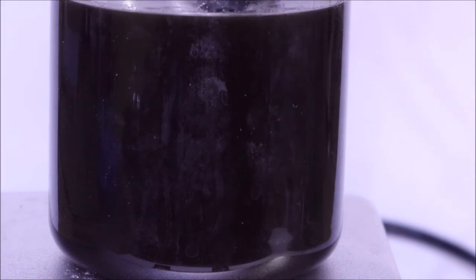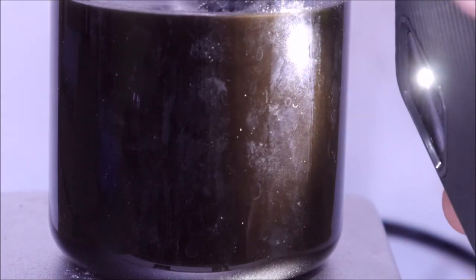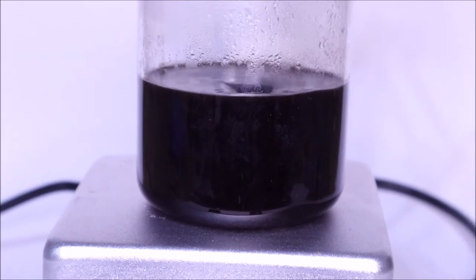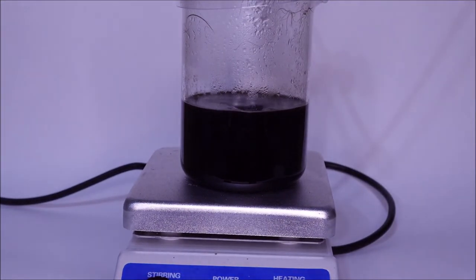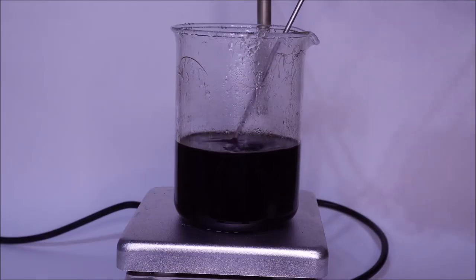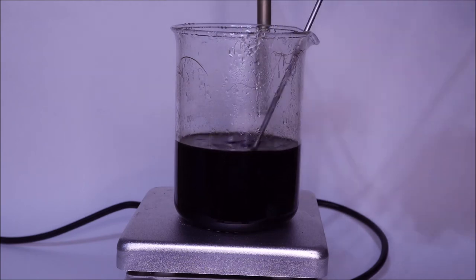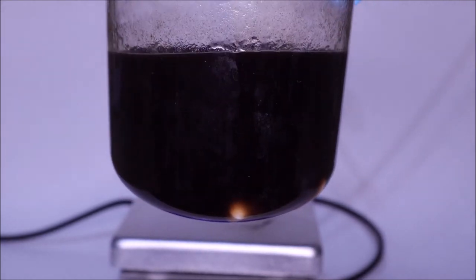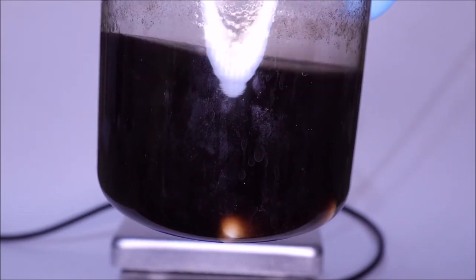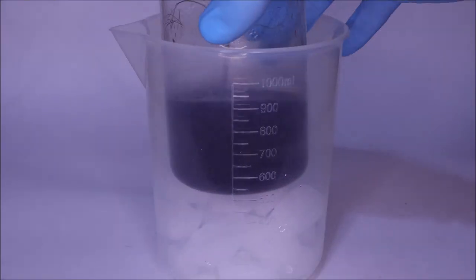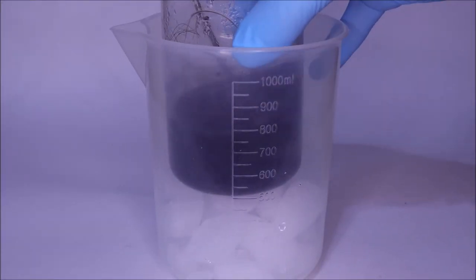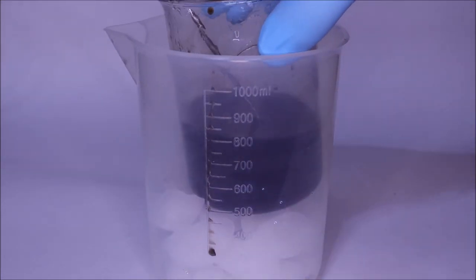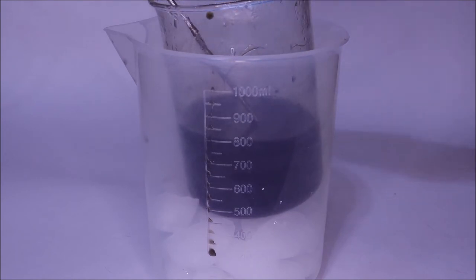Getting good footage of this material was challenging. At this point it had been overnight, and the water level is much lower than when I started. Obviously the hair has pretty much changed, and that solution is looking actually pretty viscous at this point, more viscous than when we started. That flask was very hot, so I just put it on ice to try and cool it down before I worked with it.